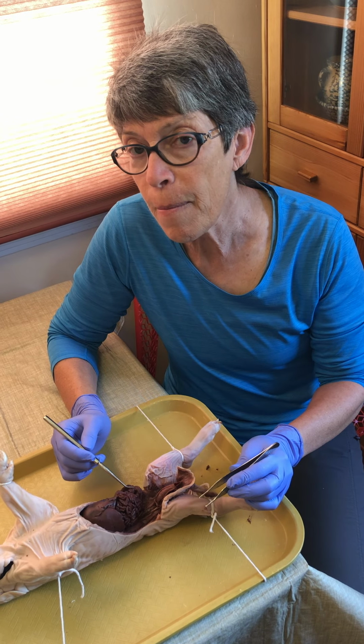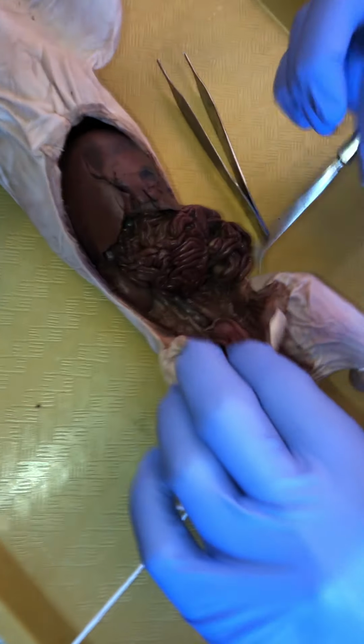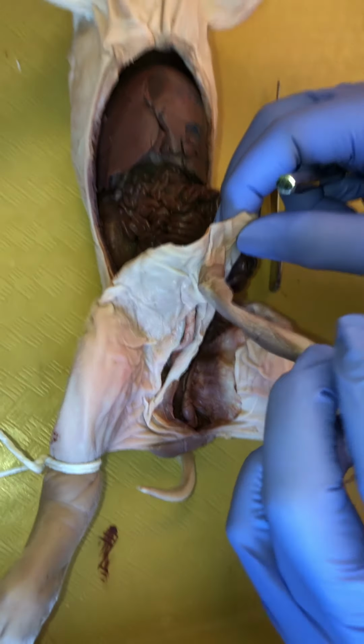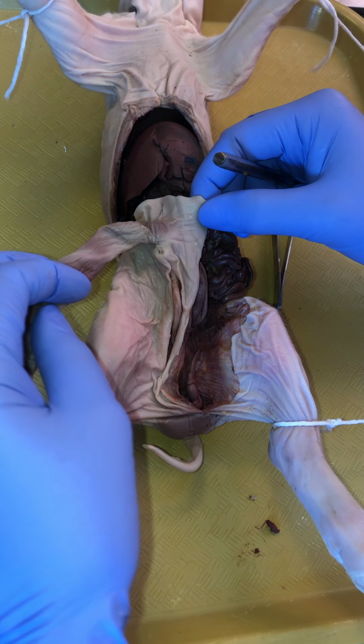Right, and now for male reproductive anatomy. All right, let's get to it. So first of all, let's just get oriented, okay? Let's just look around, okay? That looks strange. Definitely some intrusion there.